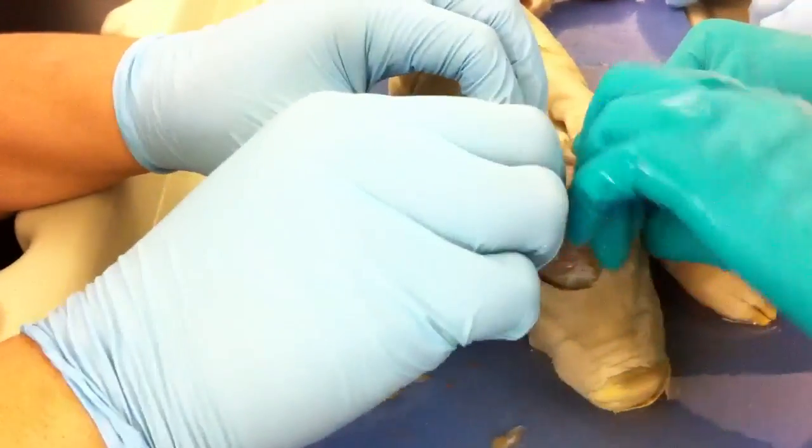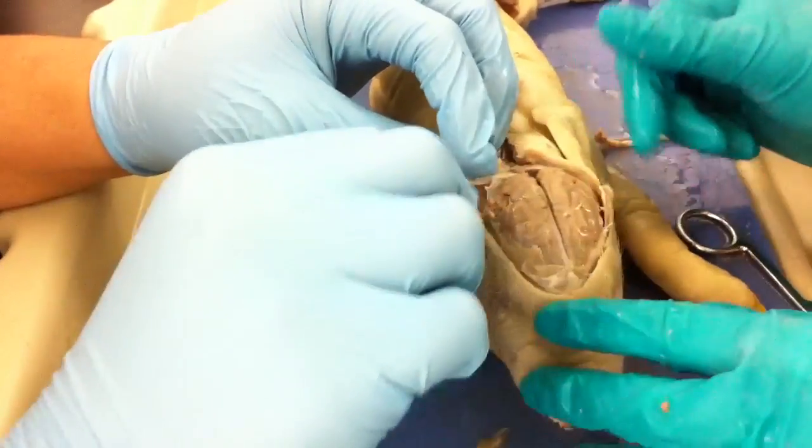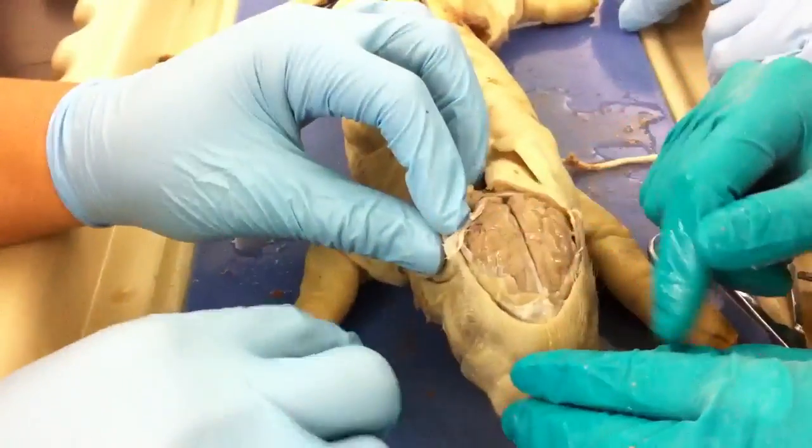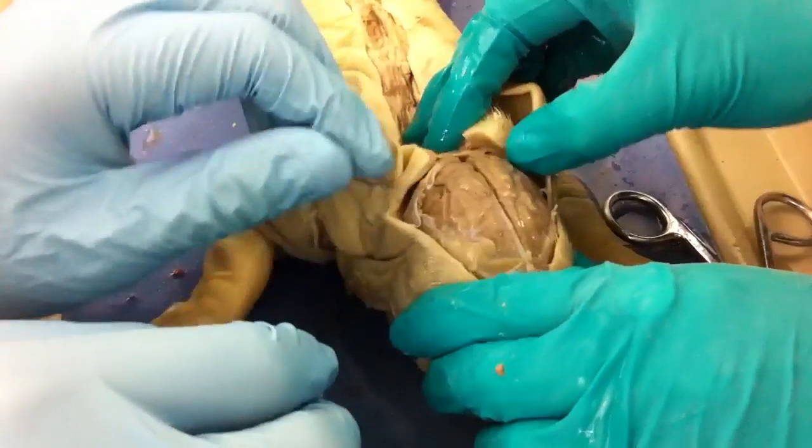Actually, parents don't care. She keeps cutting away. Dang, we messed it up. You damaged it. I don't care. I wonder how they actually get into your skull — if they do, like, brain tumors? Surgeons. Surgeons.